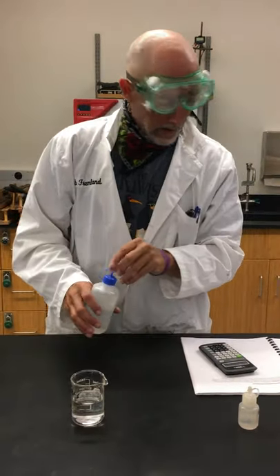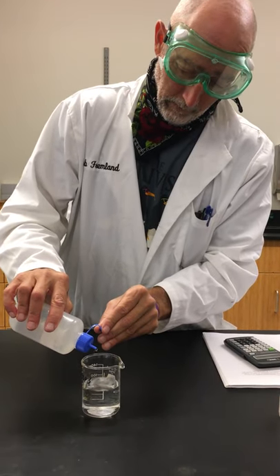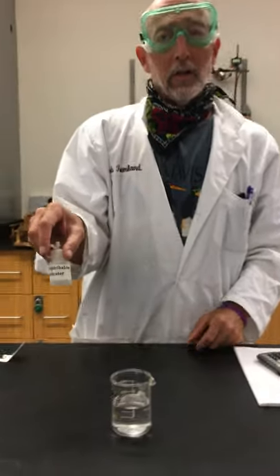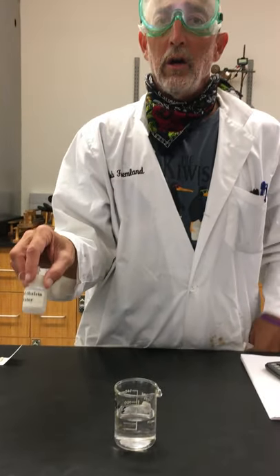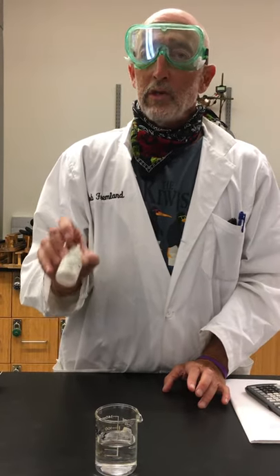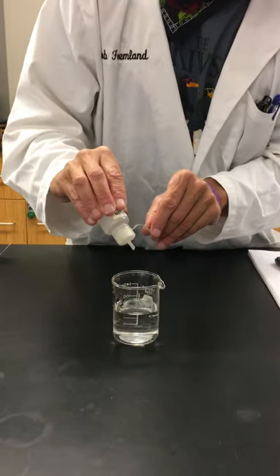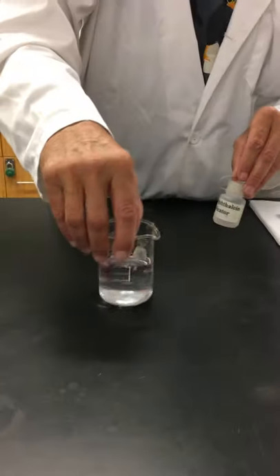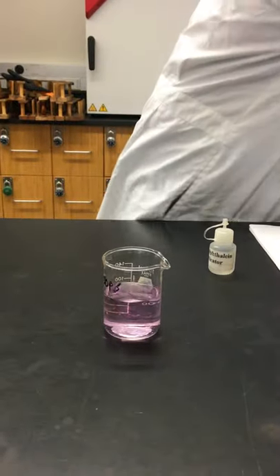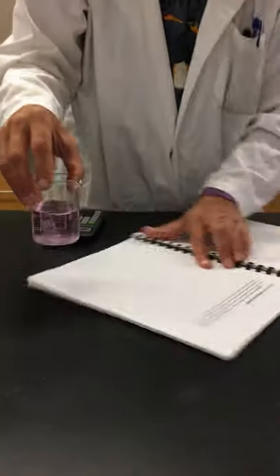I'm just going to put a small amount — following the instructions, it says add ten drops. This is a chemical indicator. Chemical indicators are chemicals that turn color in the presence of various chemicals. There's a million different indicators. This particular one turns bright pink in the presence of a base, and you can see that it's pink. Let's put a white piece of paper underneath it so you can see it a little bit better.